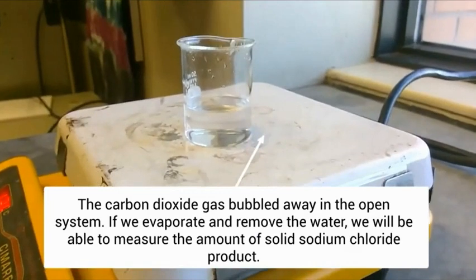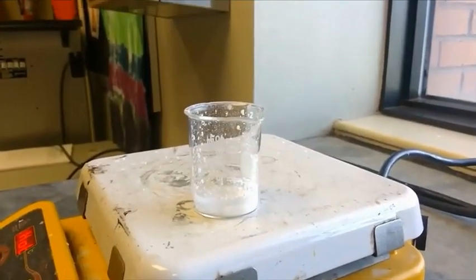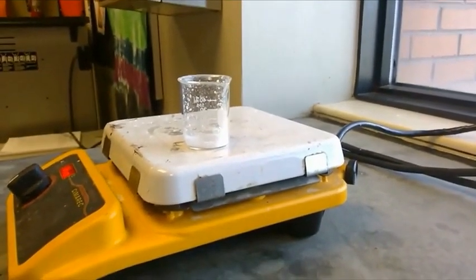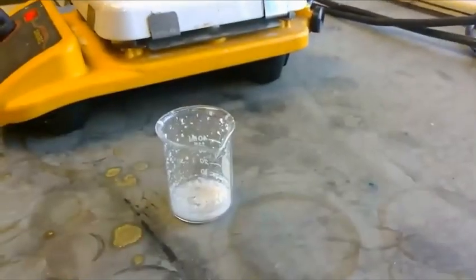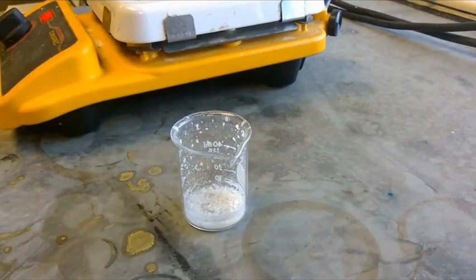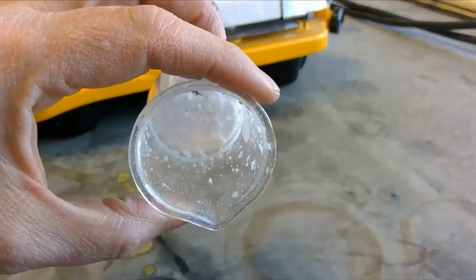All right, now we're going to just take some time to evaporate off the water so that we can measure the solid product at the end. And as you can see, it's crystallized into what looks like kitchen salt. Nice, pretty white crystals of sodium chloride, solid in the beaker.